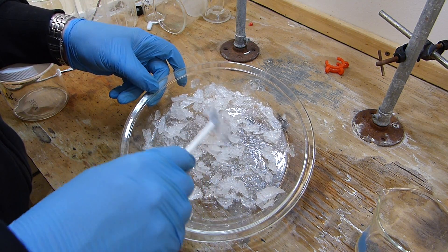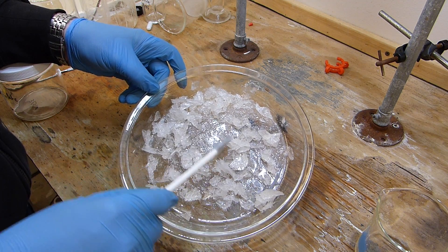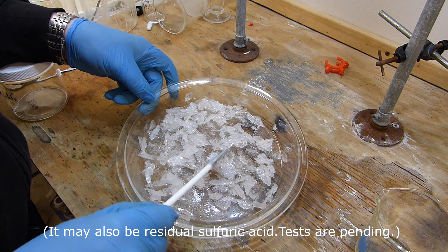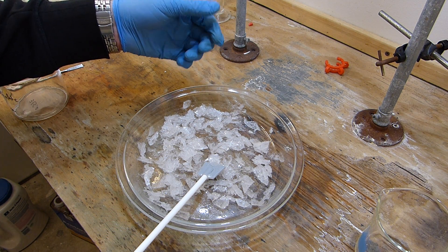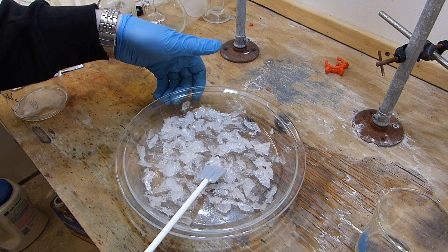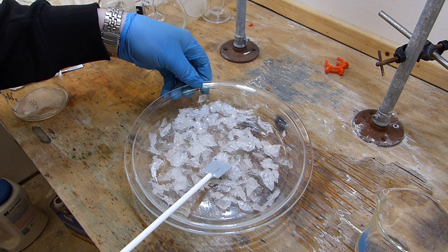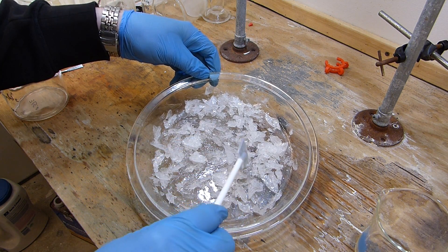All right, now this has been drying for several hours now, and you can see that it's still quite wet and liquidy. That is probably a sign that this is a deliquescent material, meaning that it picks up water readily from the atmosphere, and this is actually getting wetter than it is drier. So it turns out I'm going to have to try and desiccate this in a vacuum desiccator. That's a pretty simple procedure, but unfortunately it takes about a week to get results, so I'm not going to be able to show those results in today's video. However, I can talk a little bit about what this dimethyl oxalate is eventually going to be used for.